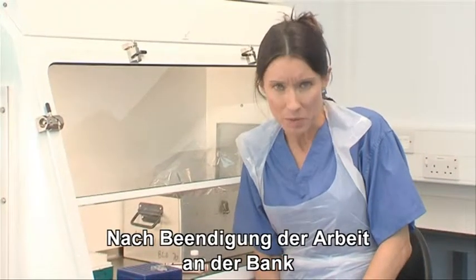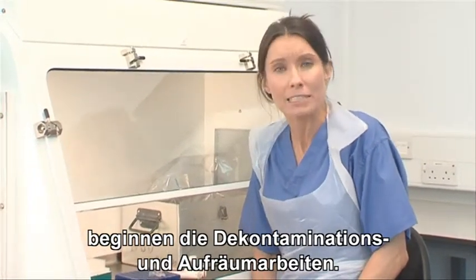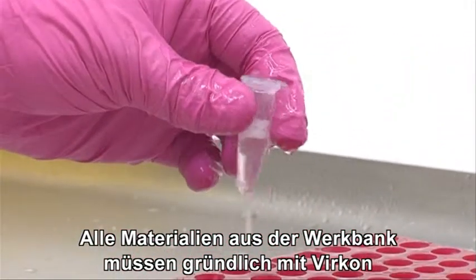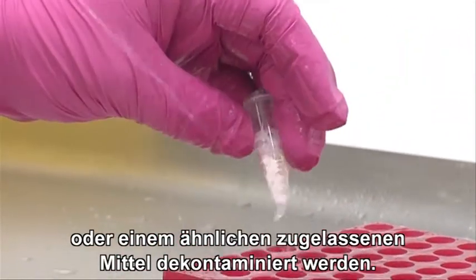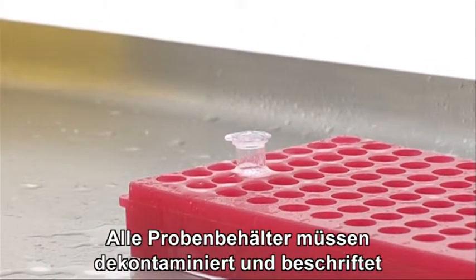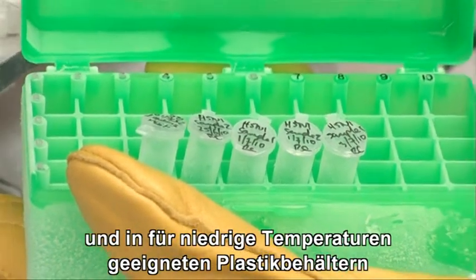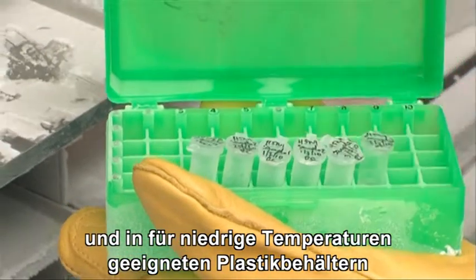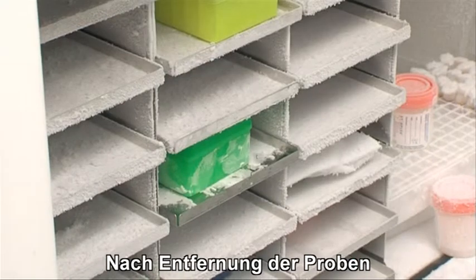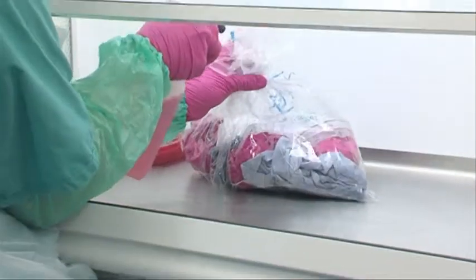Once work in the cabinets has been completed, the process of decontamination and clearing up can begin. Anything that comes out of the cabinet must be thoroughly surface decontaminated with Virkon or an approved equivalent. All sample containers must be surface decontaminated, clearly labelled in appropriate sealed plasticware suitable for low temperatures, and be stored safely in a freezer. Having removed the samples, you'll need to clean and decontaminate the cabinet.